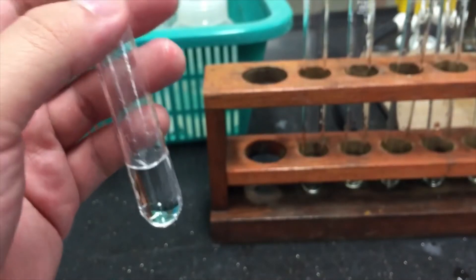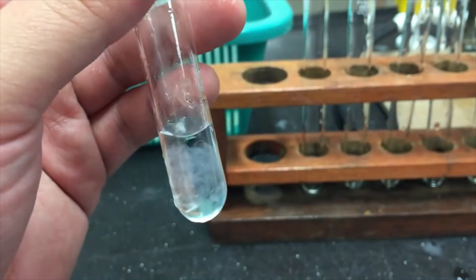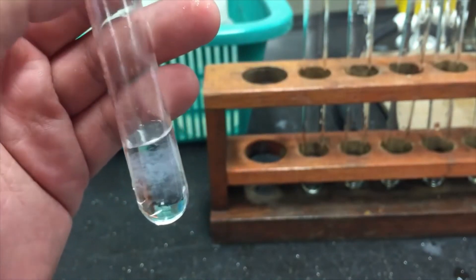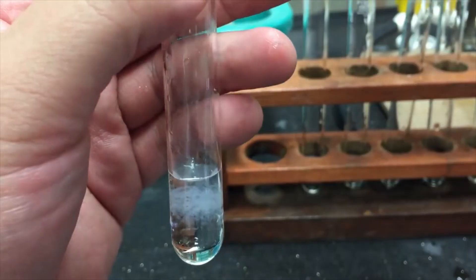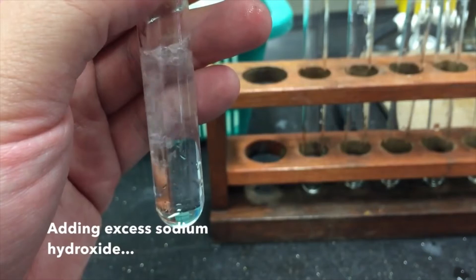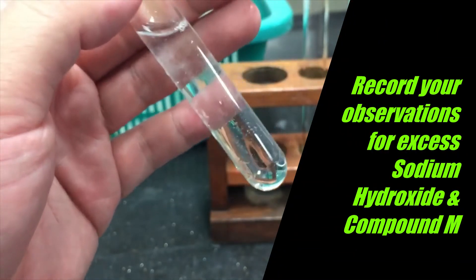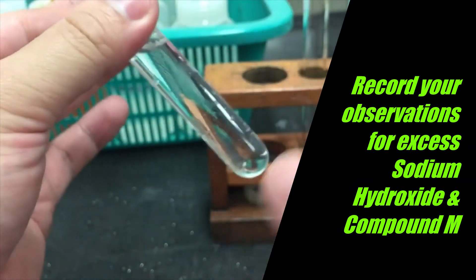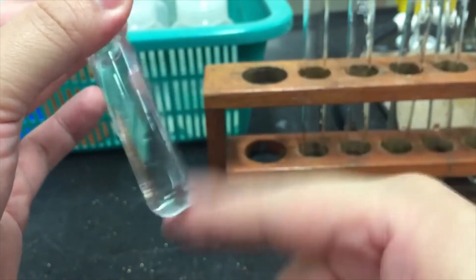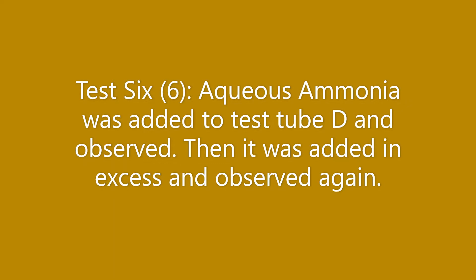To a small sample of the solution, add a few drops of sodium hydroxide. Proceed to add excess sodium hydroxide.